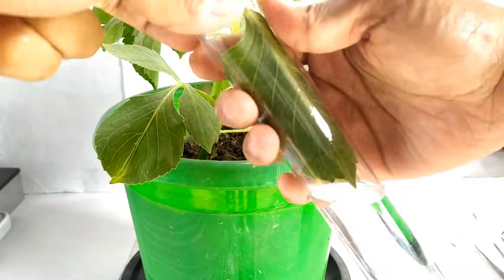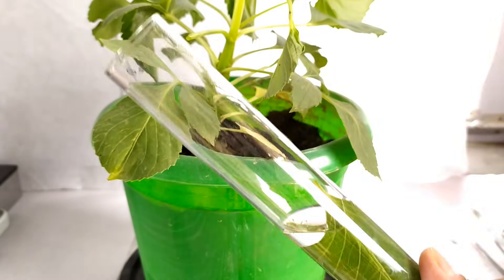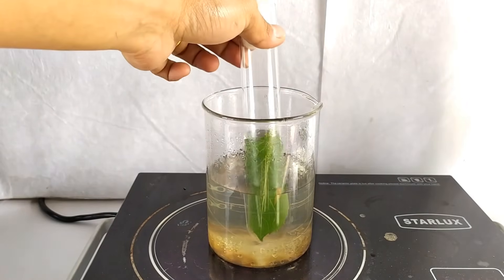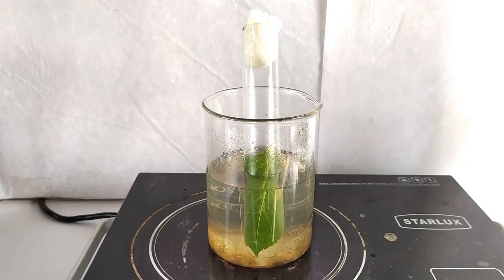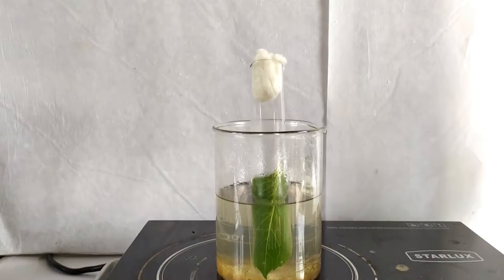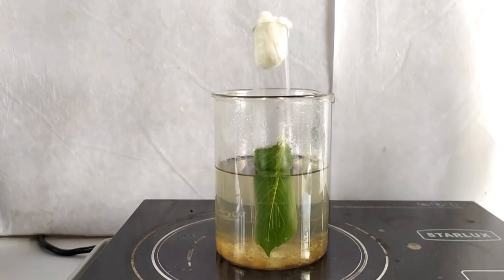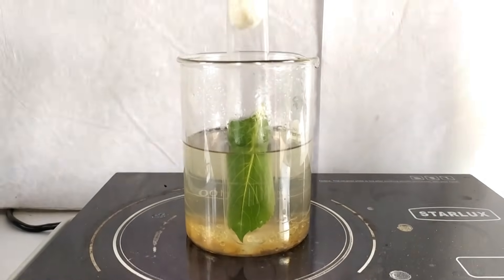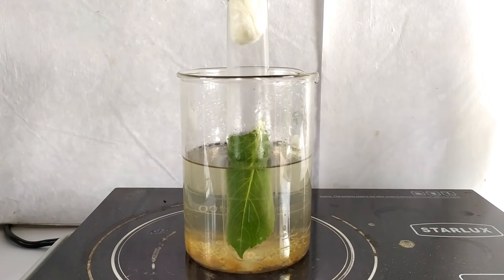Introduce the leaf into a test tube containing the alcohol solution and place the tube in the boiling water bath. If you are using an open flame such as a spirit lamp or Bunsen burner for your water bath, make sure to turn off the burner flame once the tube has been placed in the bath. This is to ensure that the alcohol fumes do not catch fire during the boiling process, given the highly flammable nature of alcohols. Alternatively, you may use a hot plate for boiling instead of an open flame.